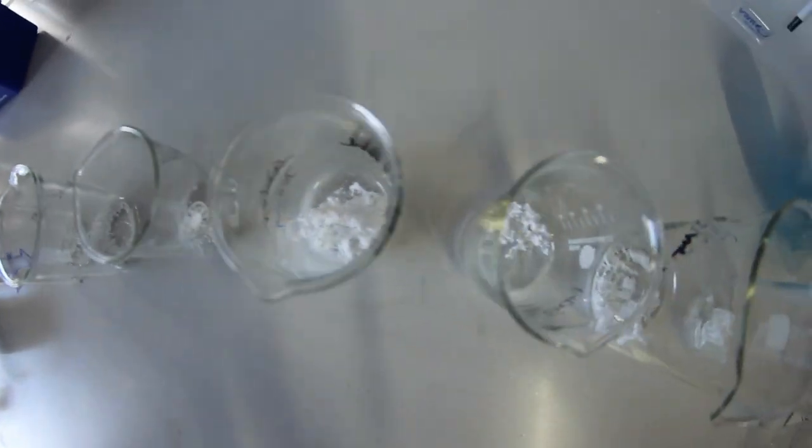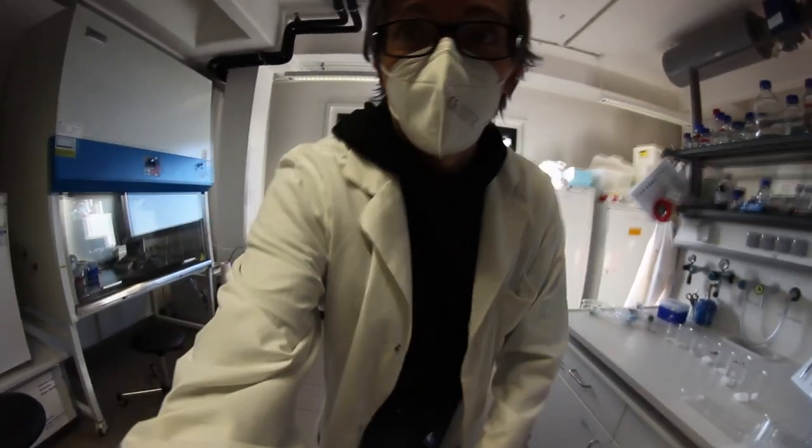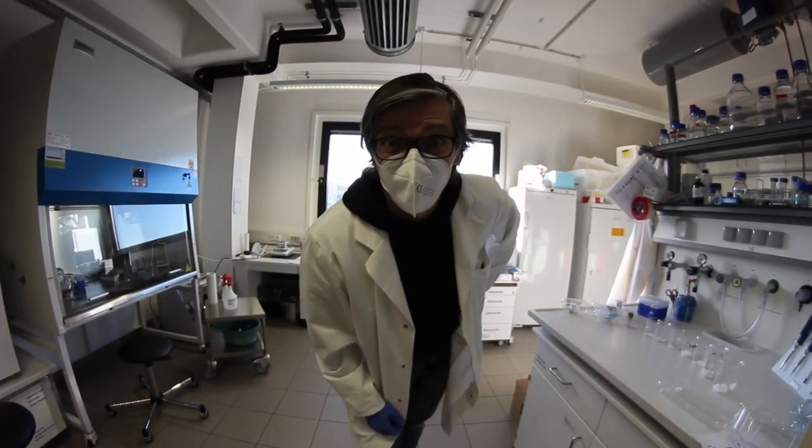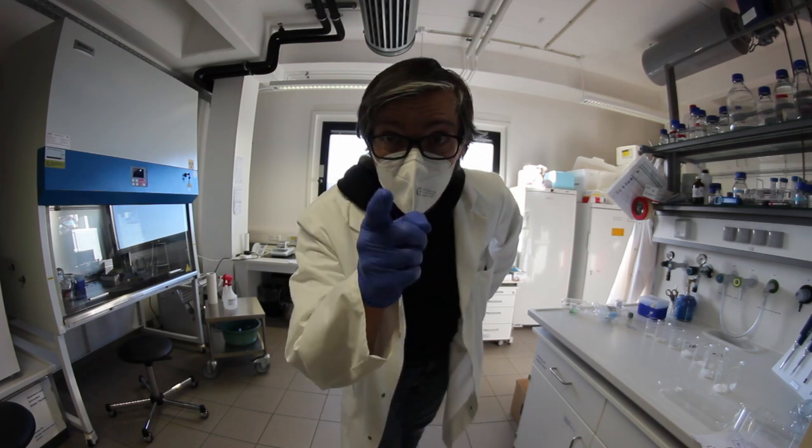This is still PET, it just looks a bit different and this is super hydrolyzable. I will now show you how good it is for the hydrolyzation process. Have a look.